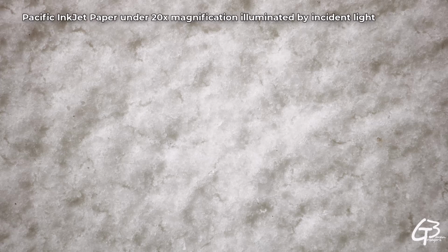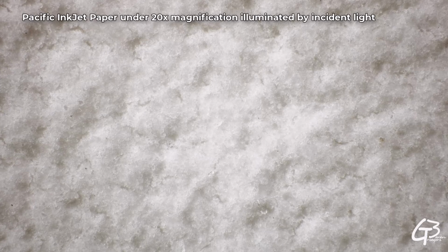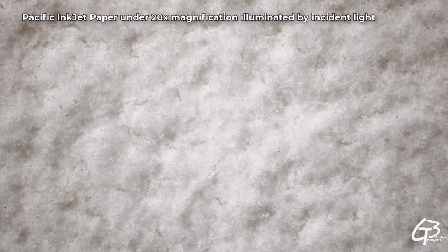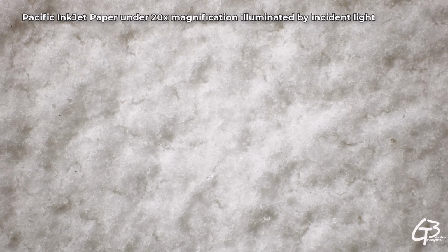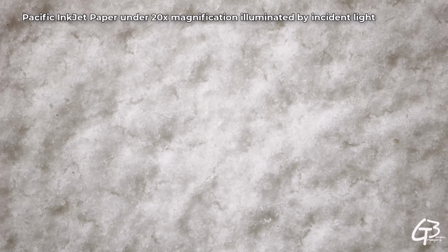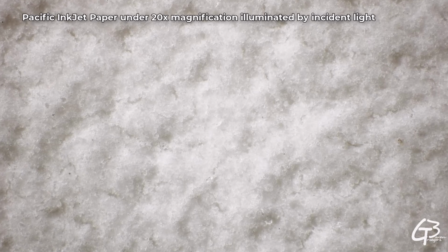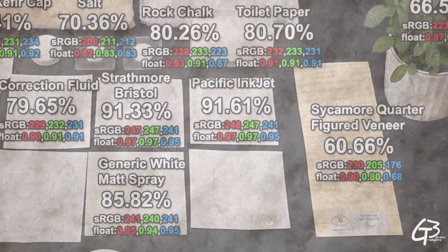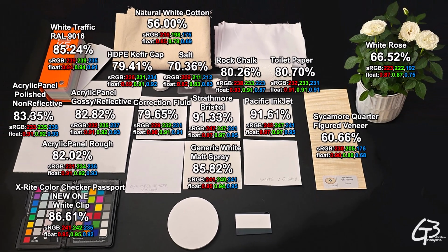Let's magnify it 20 times and see its structure. To be honest, this one doesn't resemble common paper structure. It rather looks like some form of reflective coating used to create glossy and reflective paper surfaces, which is done by applying clay-based surface sealant, but this one feels different and more powdery. Such a surface definitely looks like a great light scatterer. This paper looks really amazing, and it's so far the brightest non-OBA white paper I measured.